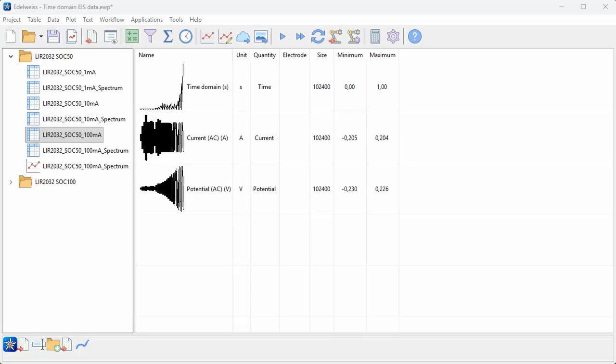This table contains all of the frequencies, so you might be able to make out in the time domain data series that the values are increasing and then they keep resetting to 0 for every new frequency. So it's basically a step time that is recorded.